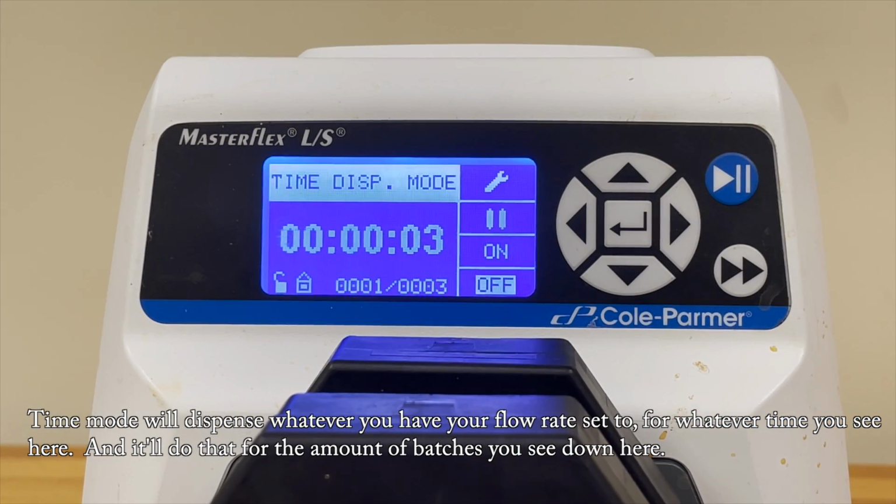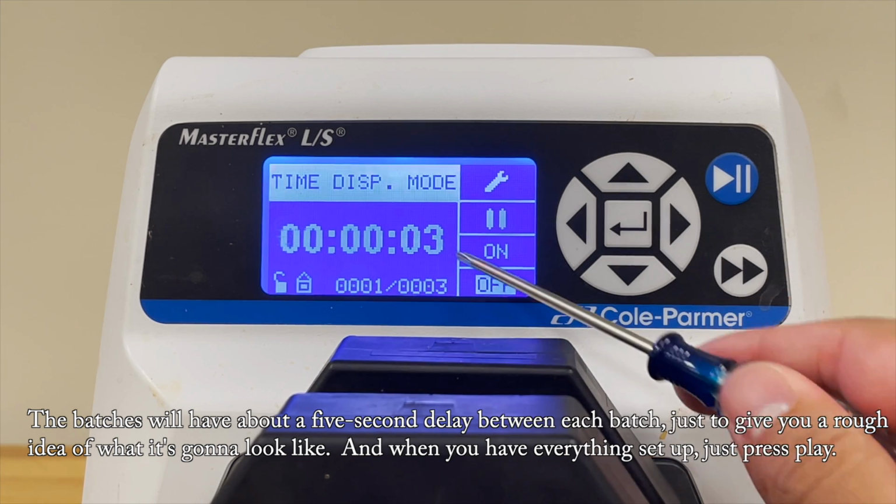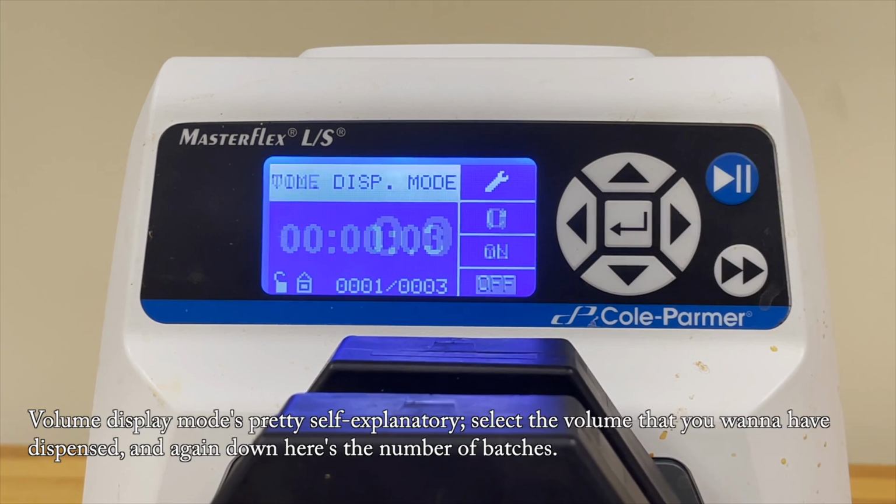Time mode will dispense whatever you have your flow rate set to for whatever time you see here. And it'll do that for the amount of batches you see down here. The batches will have about a 5-second delay between each batch, just to give you a rough idea of what it's going to look like. And when you have everything set up, just press play.